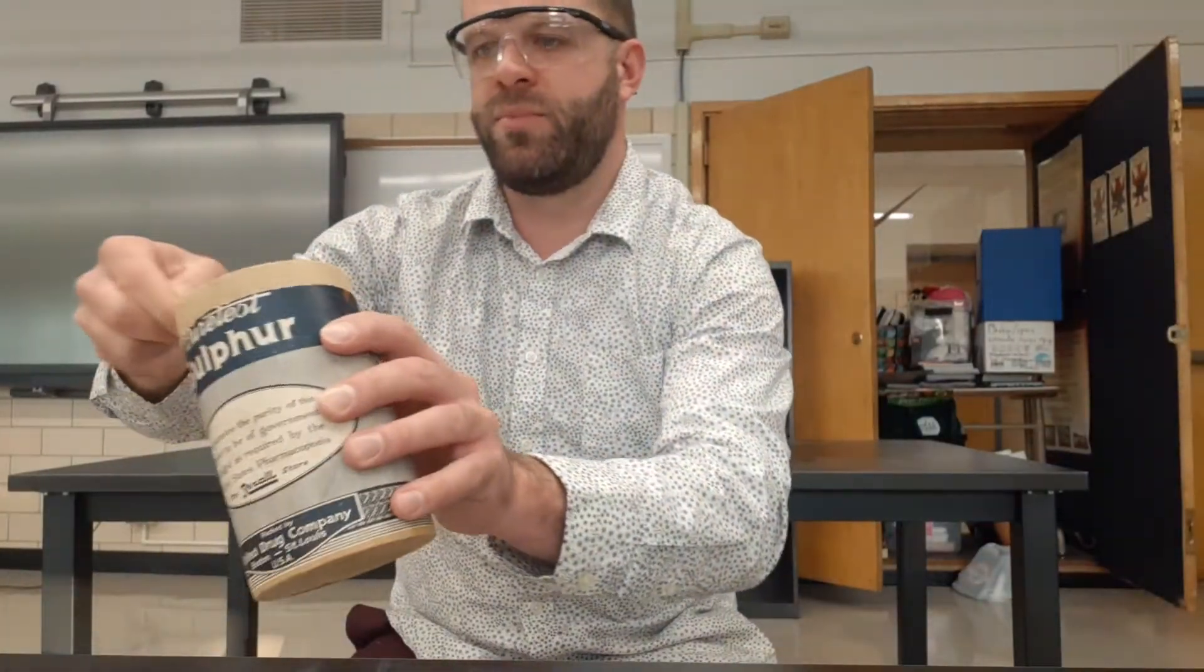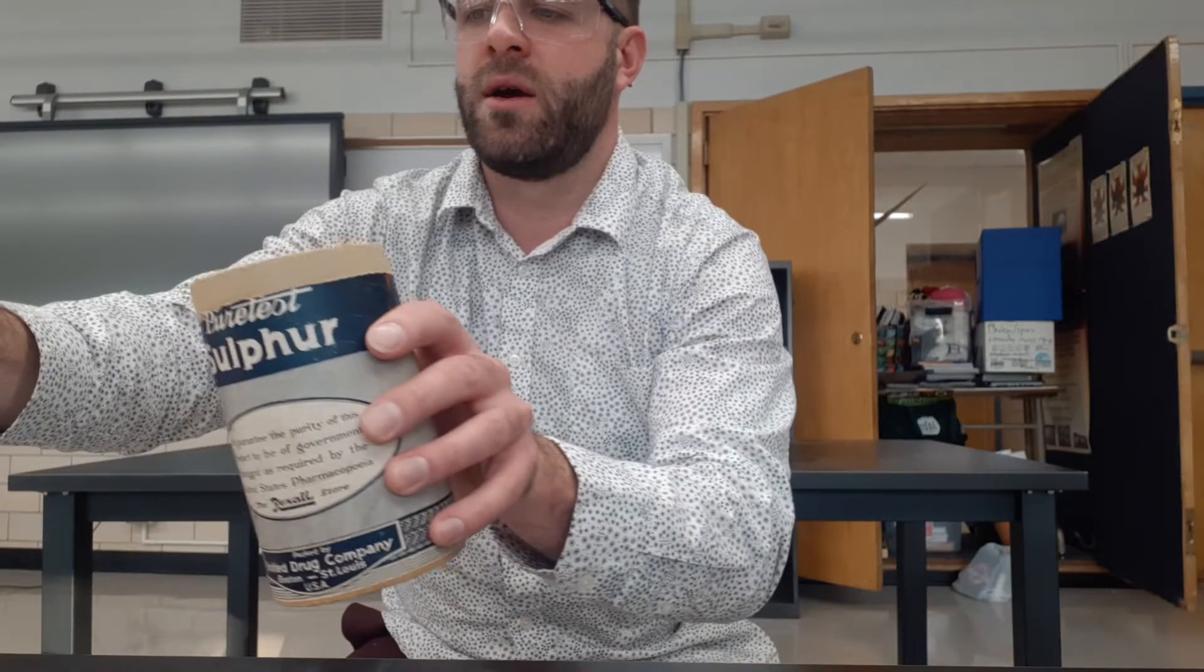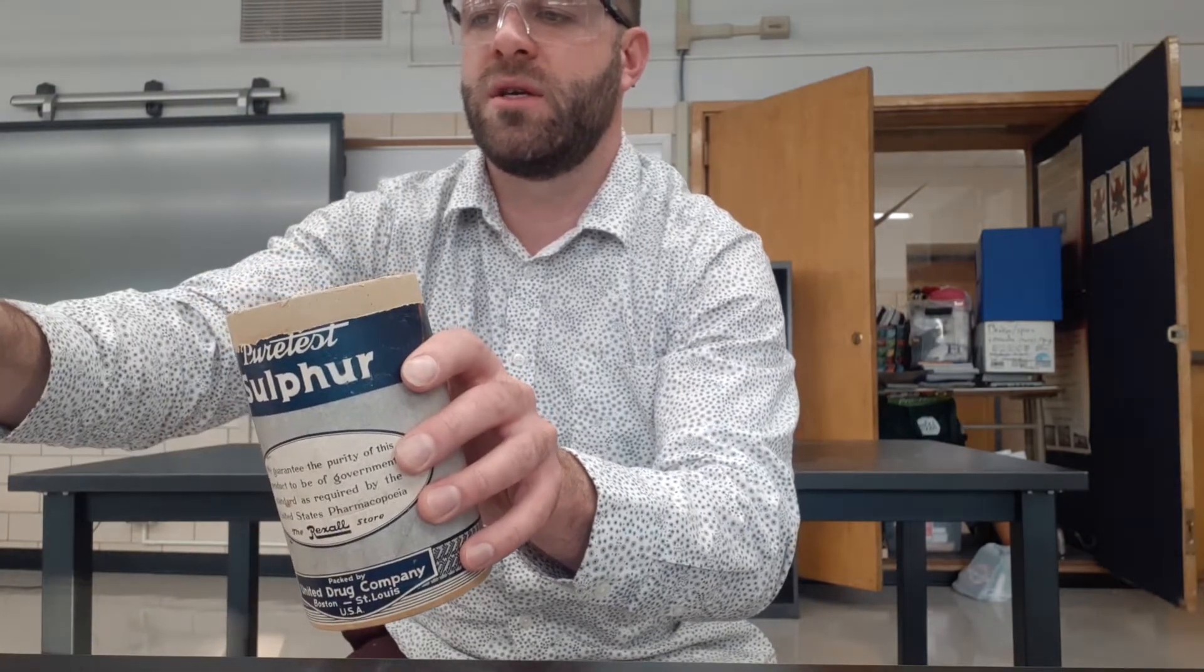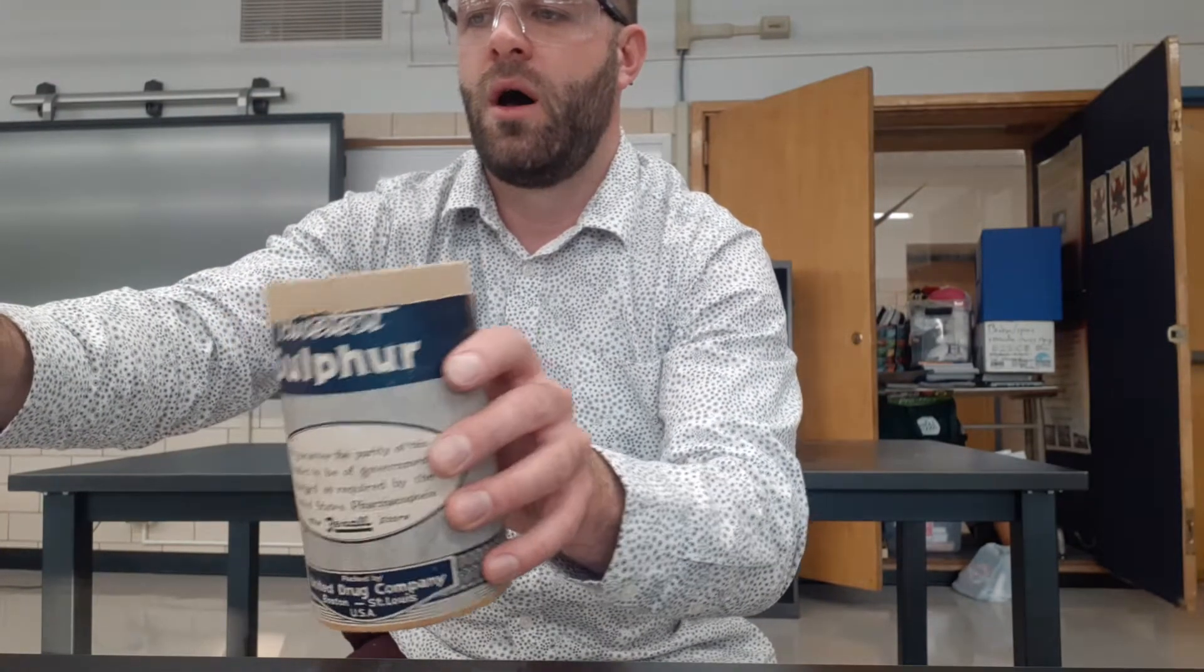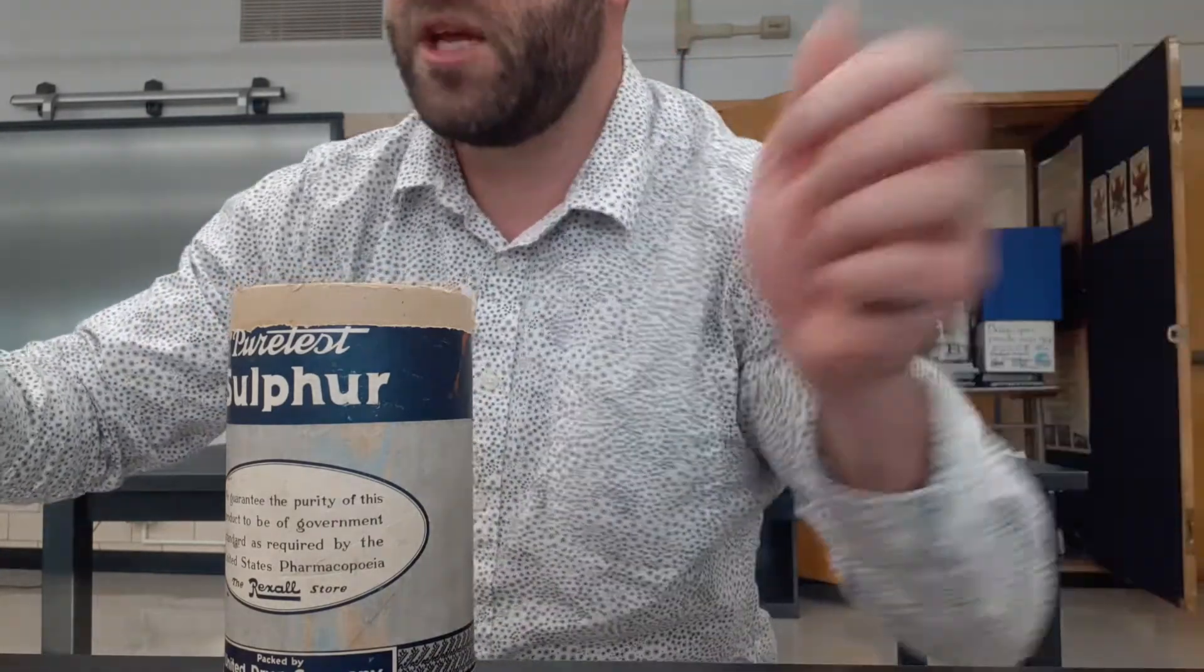So put some sulfur on our surface of water here. Looks good, looks good. Oh, that's cool. I'm gonna take my camera here and show you guys.